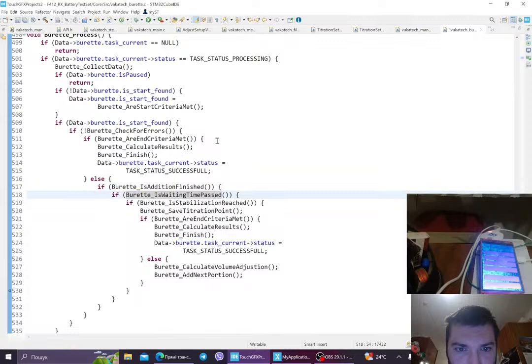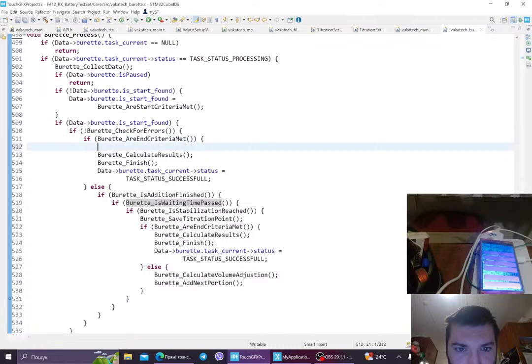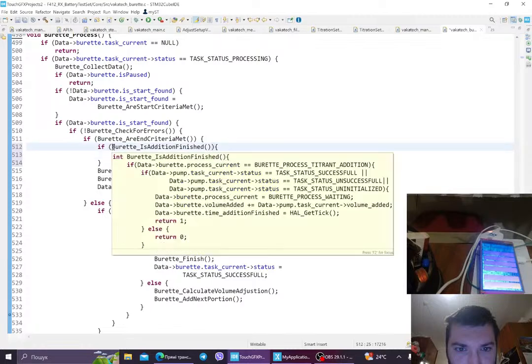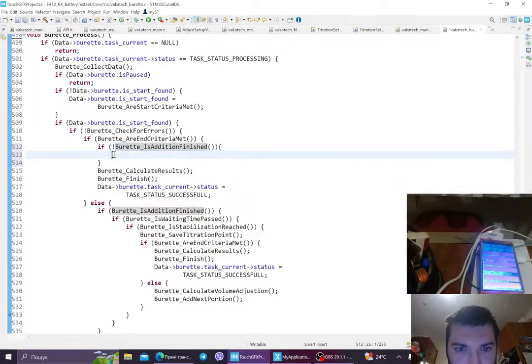Again, like if criteria are met, and if addition is finished, I think here I should add, yeah, if it is finished. If it's not finished, yeah, then we have to stop the peristaltic pump.